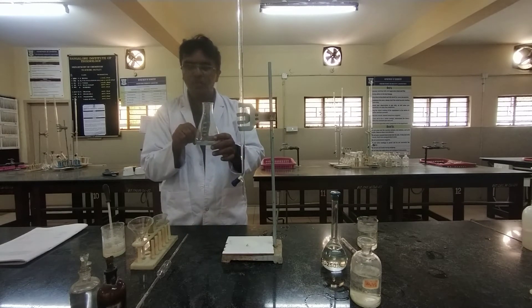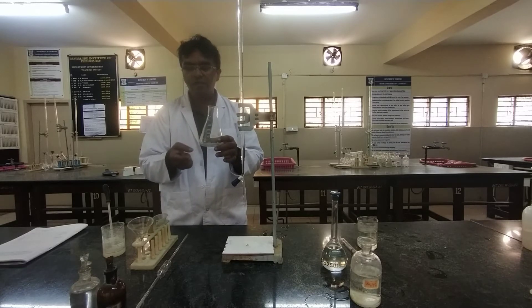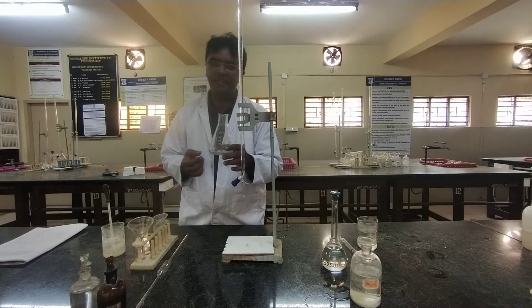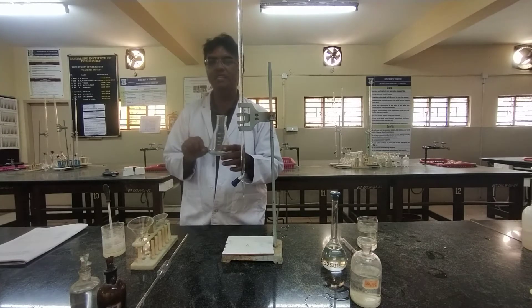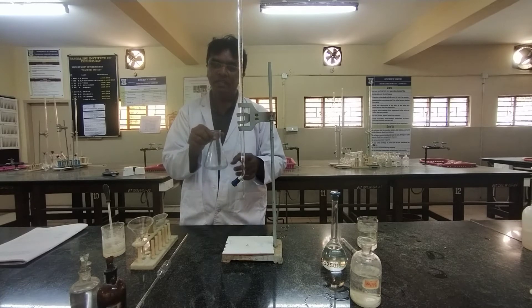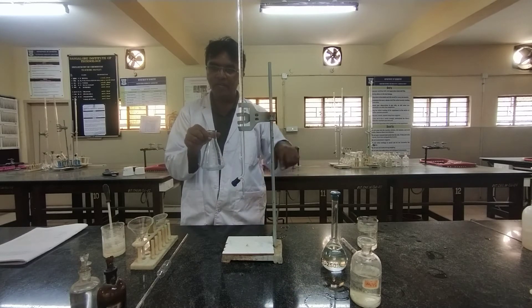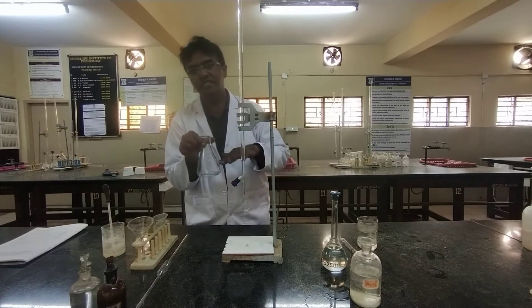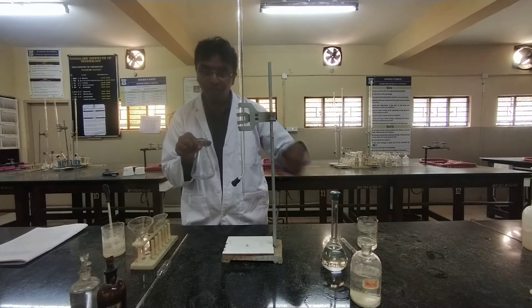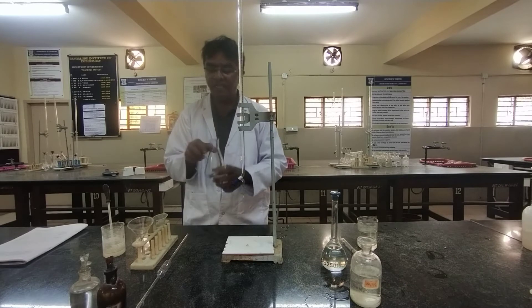While preparing the brass solution we add concentrated nitric acid, and to ensure complete dissolution we add a few excess drops of nitric acid. That excess nitric acid remains in the solution. Since nitric acid is also a powerful oxidizing agent, if you add potassium iodide at this stage, the copper ions will oxidize KI into iodine but the nitric acid will further oxidize that iodine to iodic acid, causing some iodine to be lost and giving a wrong result. Therefore, before adding potassium iodide, we must remove or neutralize the excess nitric acid.